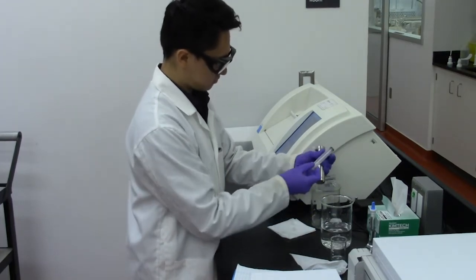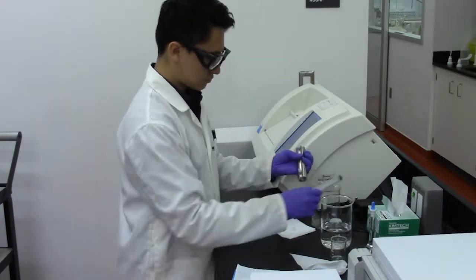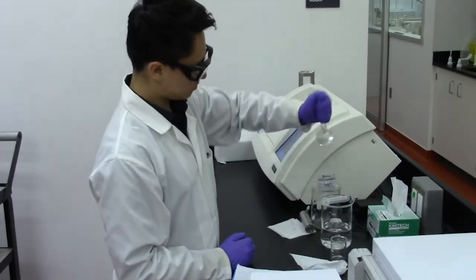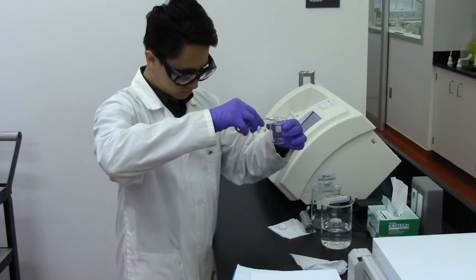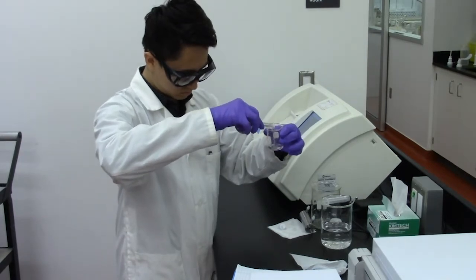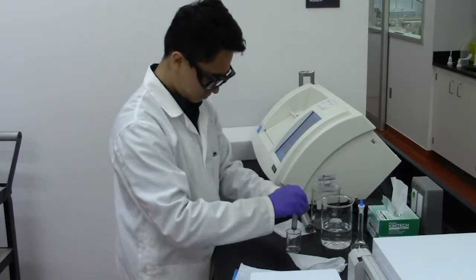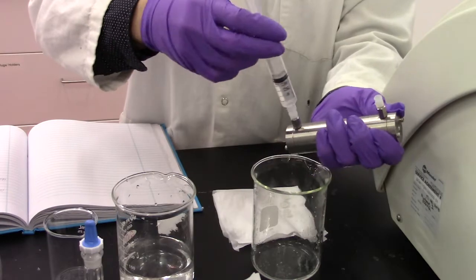You will repeat the previous procedure to find the observed rotation of your unknown substance. Pour sufficient amounts of sample from your volumetric flask and into a beaker. Using the same syringe, draw out your solution from the beaker and insert into the proximal end of the polarimeter sample holder.